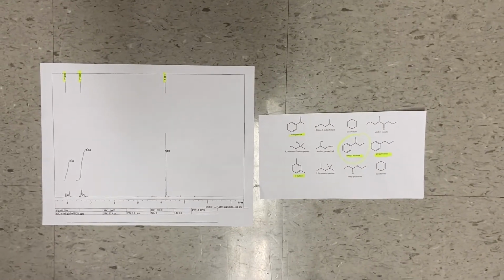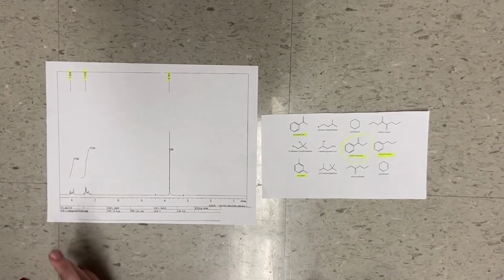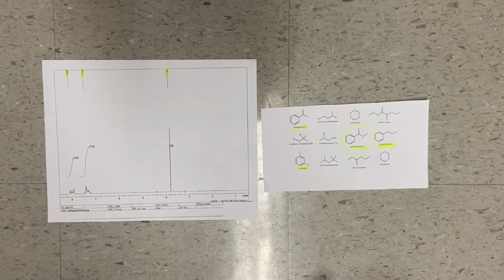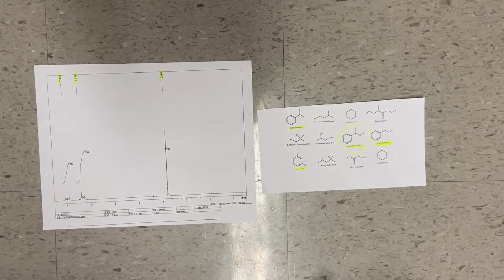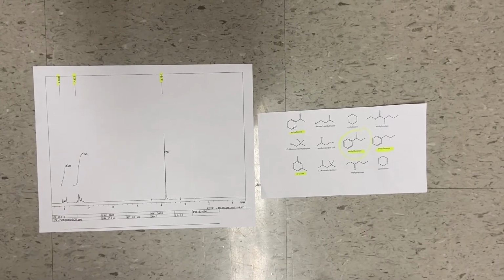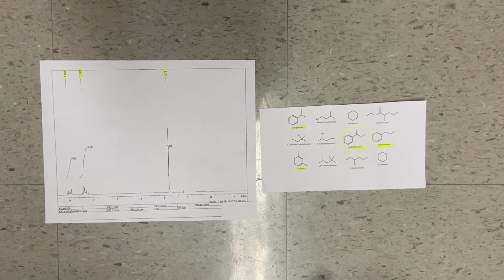The spectrum is not acetophenone because there is no peak present around 2.1 ppm, which would indicate a hydrogen next to a carbonyl group. The integration values for the spectrum were multiplied by 2 to get them to a whole number. These values show how many hydrogens are present on that type of carbon.